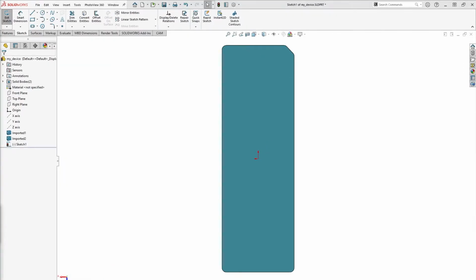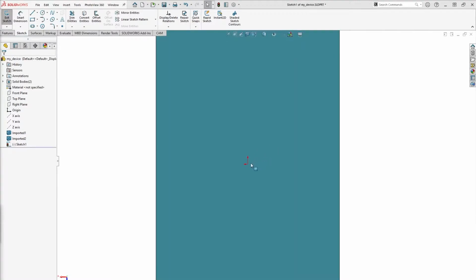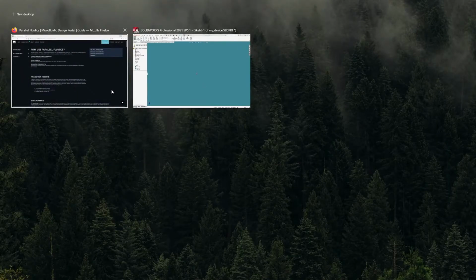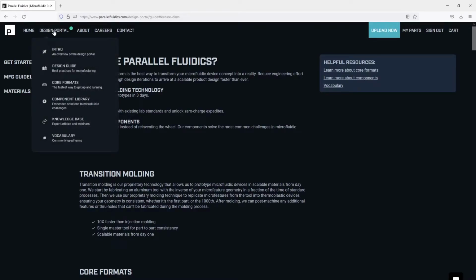We'll start the CAD model with the cross-junction region, since this is the most critical area of our design. I'll zoom in a bit because we're going to make some pretty small features here. Speaking of which, before we begin, it might be a good idea to review some design guidelines to make sure that our device will be manufacturable from the start. Let's pop back over to the Parallel Fluidics website, hover over Design Portal, and select Design Guide.